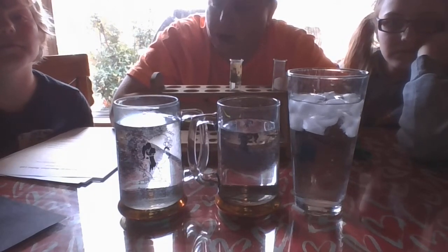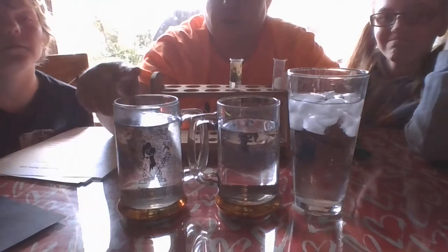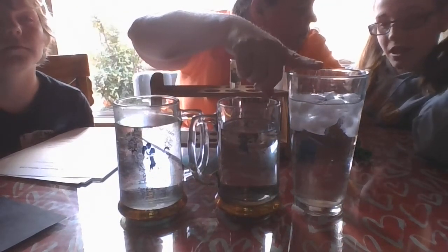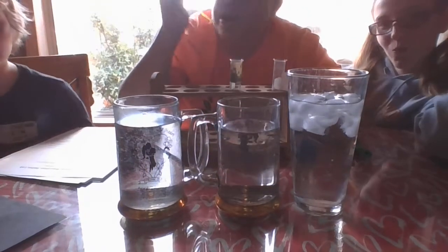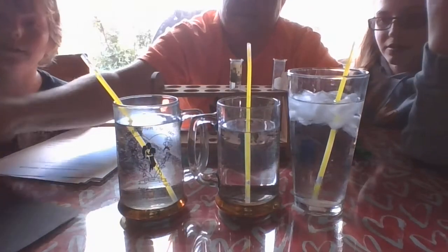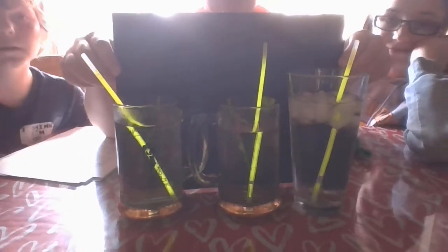Alright, welcome back. Now that you've done that, we're going to go ahead and put our glow sticks in in just a minute. Jace is going to put his into the hot, I'll put mine into the warm, and Josie, I want you to put yours in the cold — not your mouth. Alright, here we go. One, two, three, and go. Hot tamale! So we're going to watch these for a minute as they're in hot, warm, and cold.